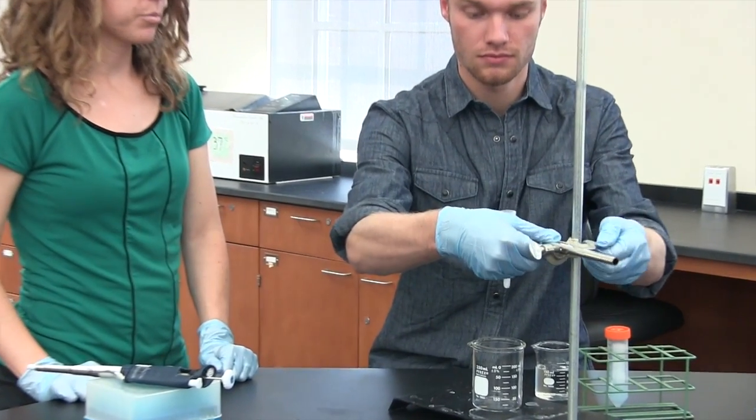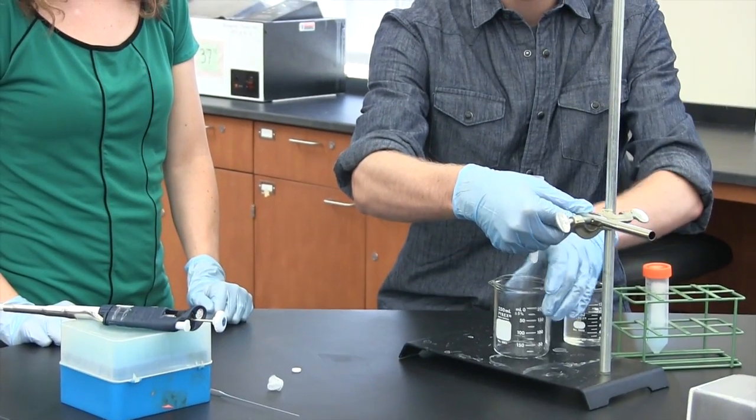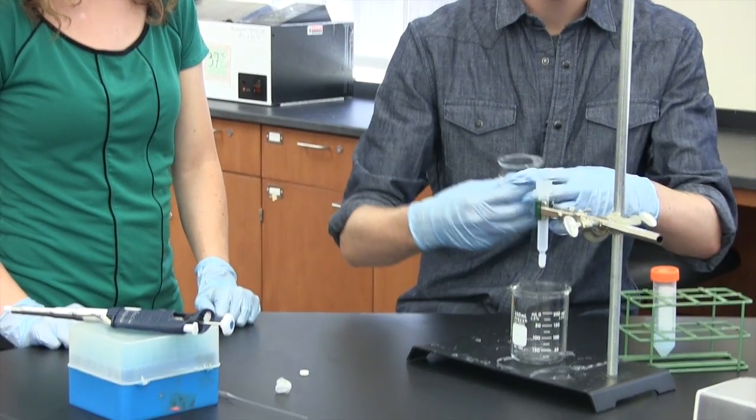The first thing you have to do is fill it up with the buffer. We have a beaker of buffer right here, so just fill it all the way up.